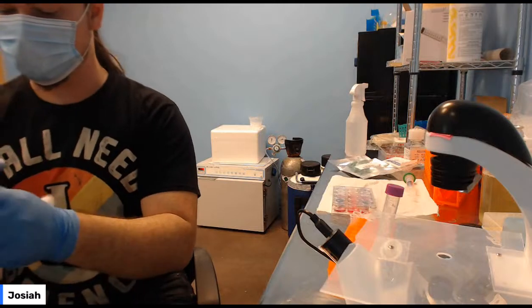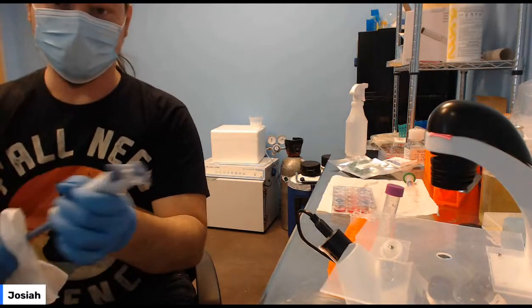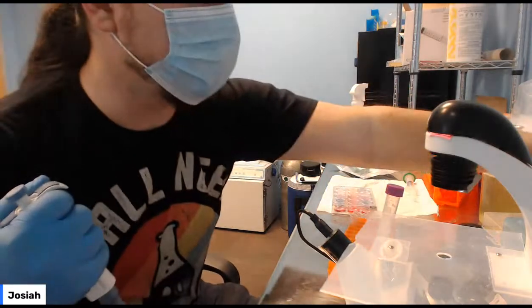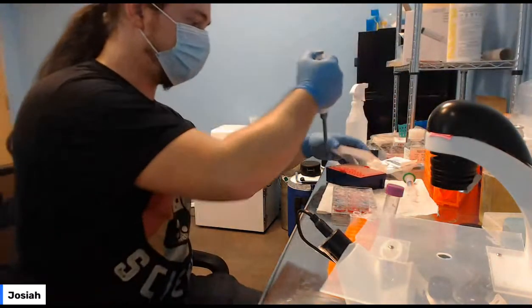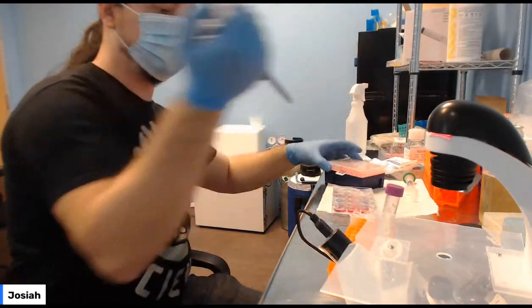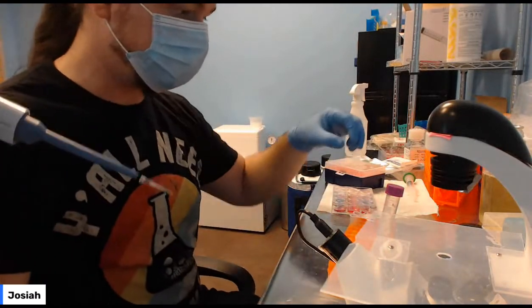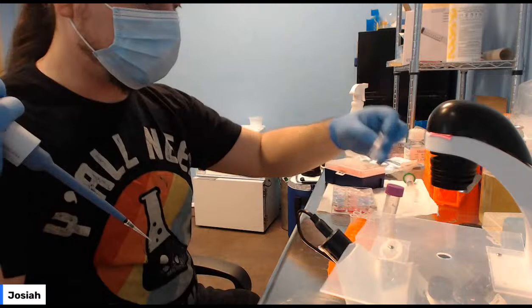Practice if you need to. Get good at looking at it and telling, okay, there is something in my pipette tip, because these pipette tips are really, really small. So 3 microliters. You can take your calfectin.